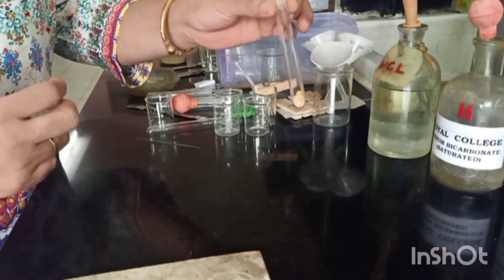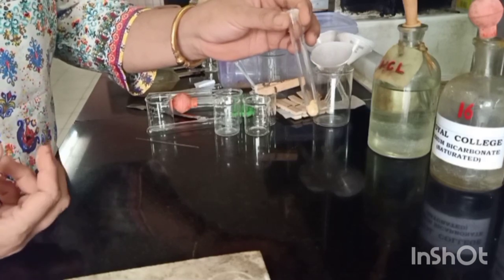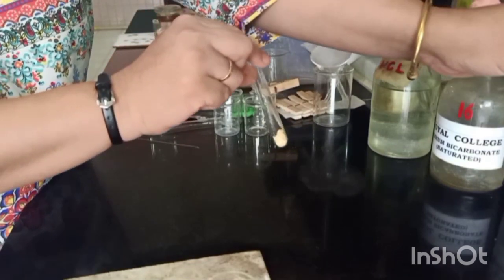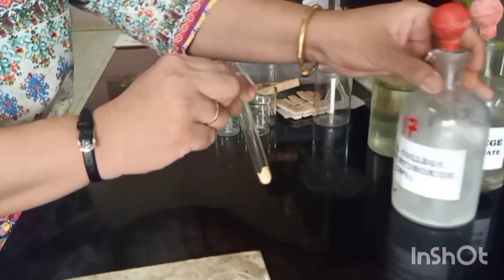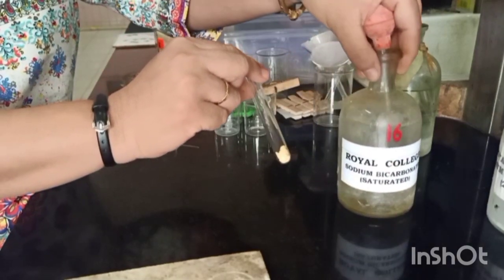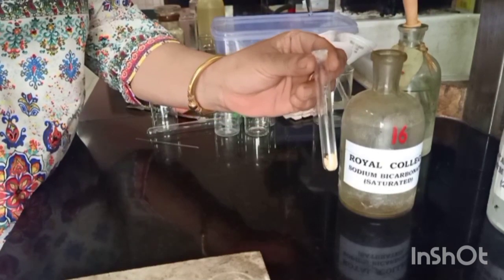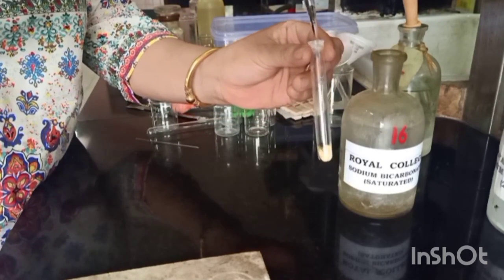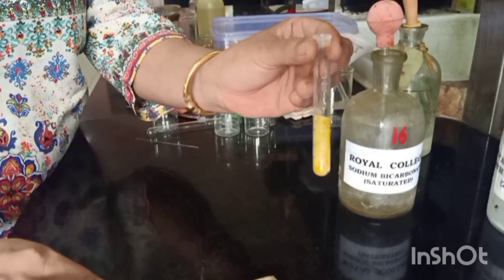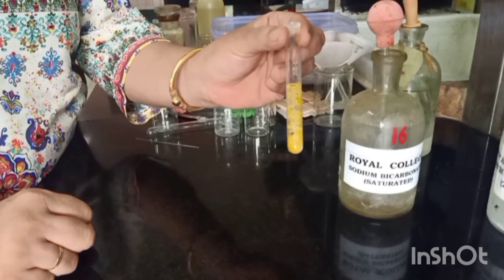In the scheme of things, the first test is for an acid. An acid is detected in the presence of sodium bicarbonate. So let's add sodium bicarbonate to this and check for effervescence. As you can see, we are getting brisk effervescence, clearly indicating that an acid is present.